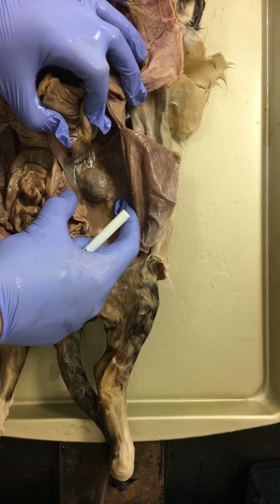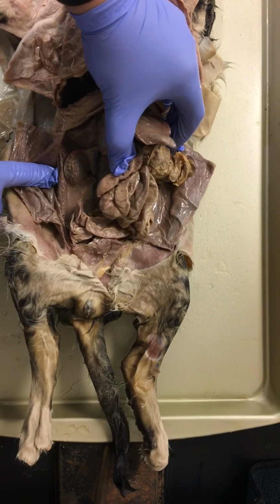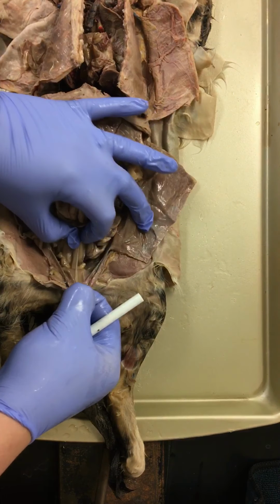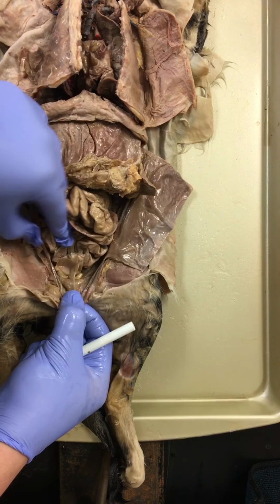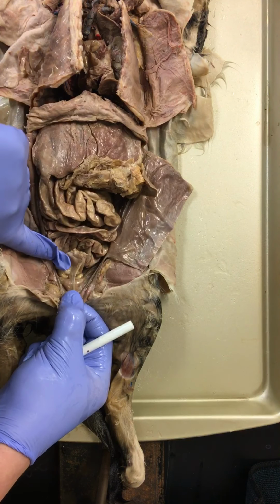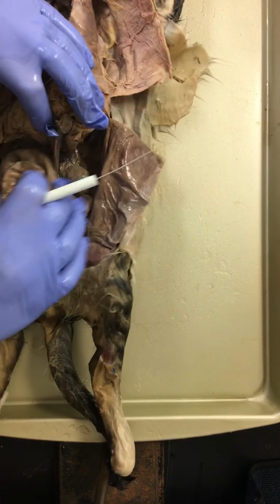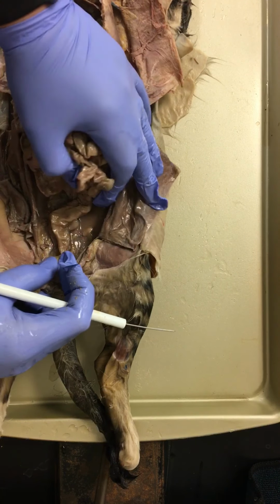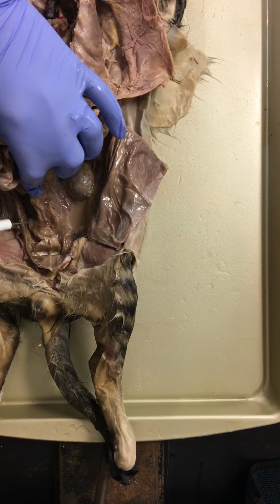On the back side, we can see our kidneys on both sides, very easily spotting those kidneys. From there, we see a couple more things, just easily exposed. Again, we're just exposing this easy stuff. We'll go through all of them again. This is the urinary bladder right here. And from the urinary bladder, we can see directly behind that, here's our colon, our descending colon.